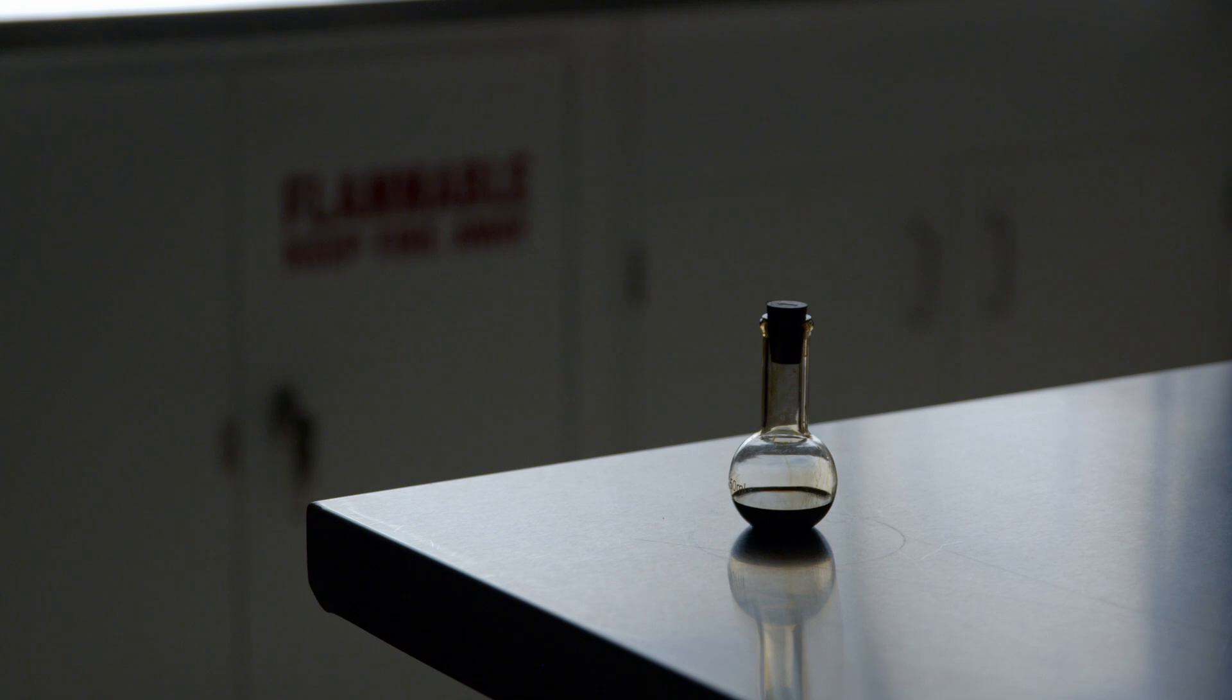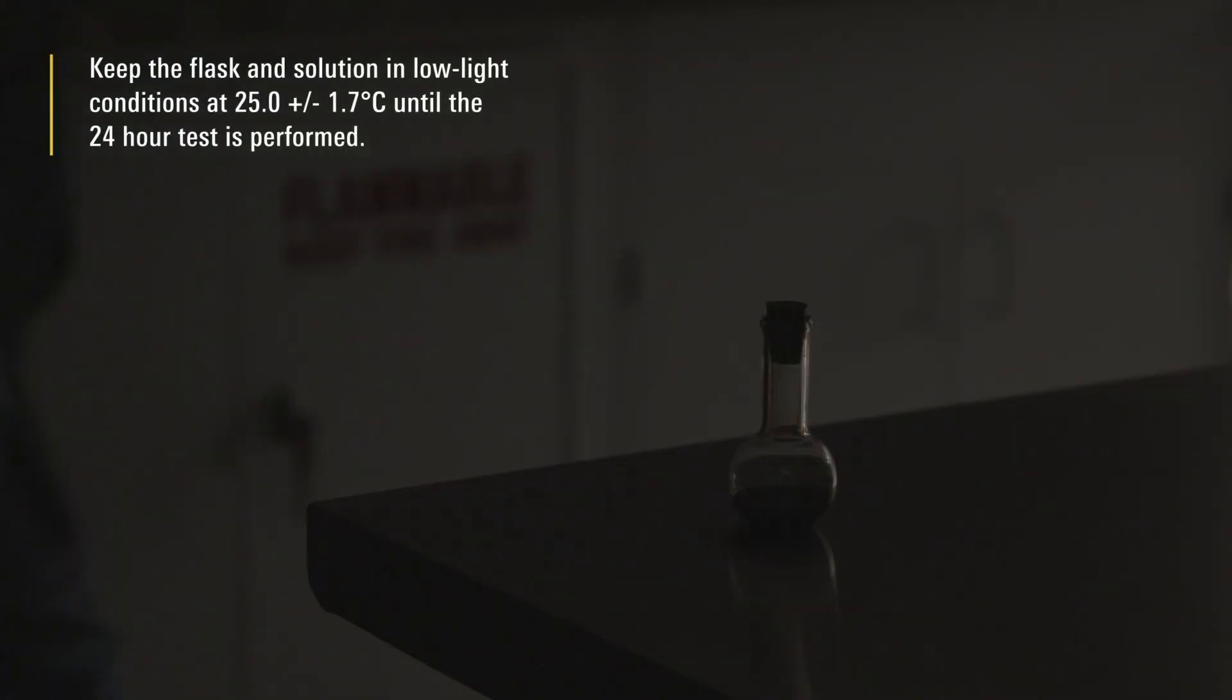After the initial testing is complete, keep the flask and solution in low light conditions at 25.0 plus or minus 1.7 C until the 24-hour test is performed.